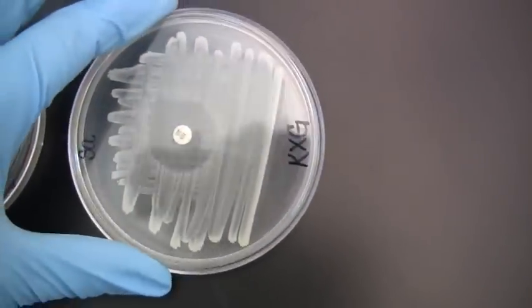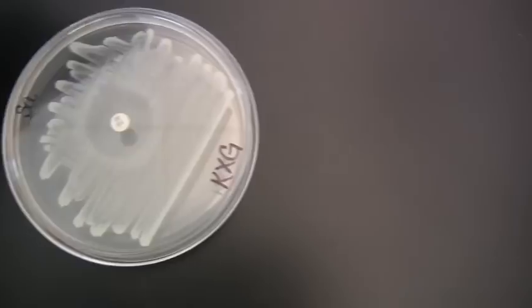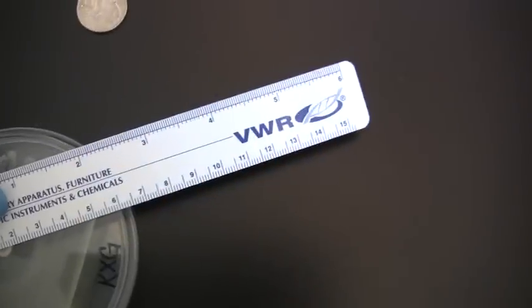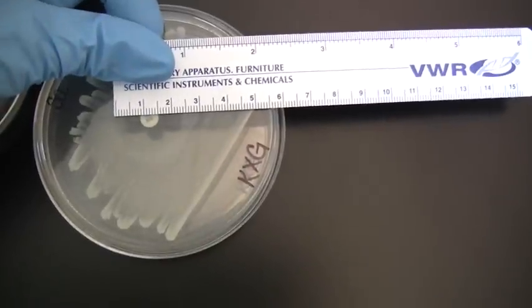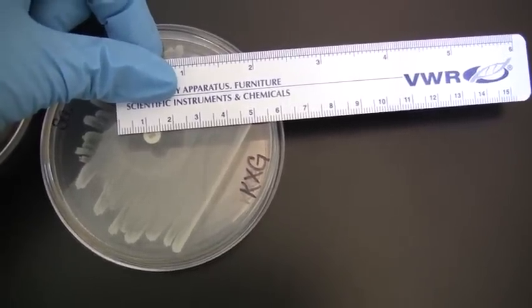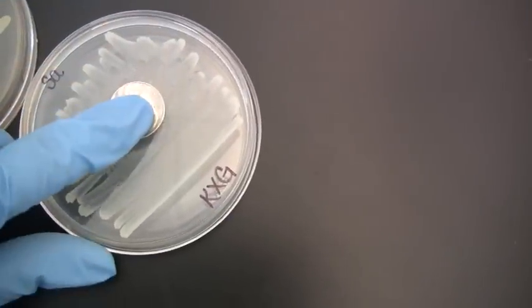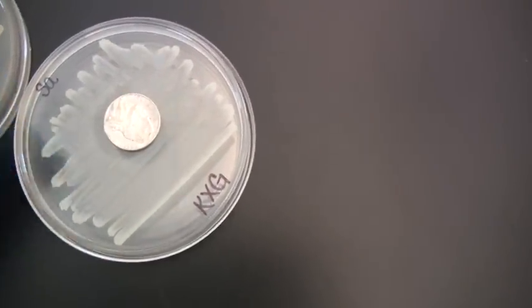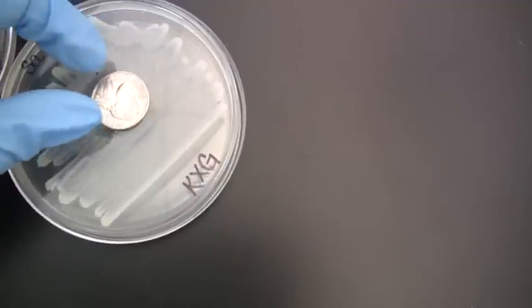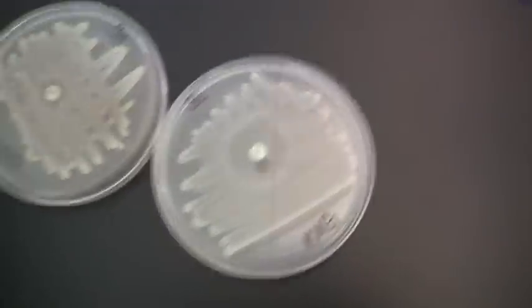And again, we're looking at our 16 millimeters. So I'm going to put my ruler here. And this one's going to exceed that by quite a bit. So we want to look for a clearing around the disc of at least 16 millimeters in diameter. Here we have well over 20 millimeters, so probably somewhere around 23 to 23 and a half. Another good rule of thumb, although you don't want to be pulling out your spare change, is to look for nickel-shaped clearing or larger. However, that's actually a little bit more than 16 millimeters. So if you have at least a nickel shape or larger, then you've got sufficient clearing.